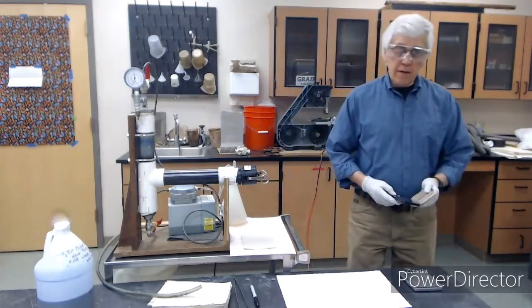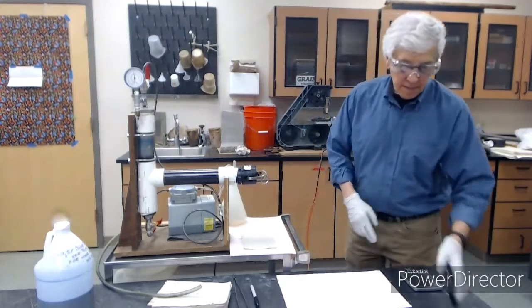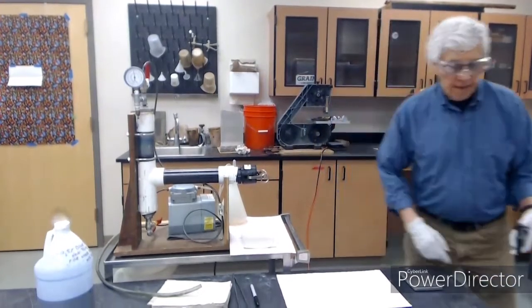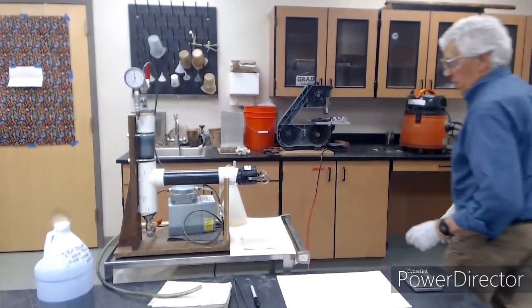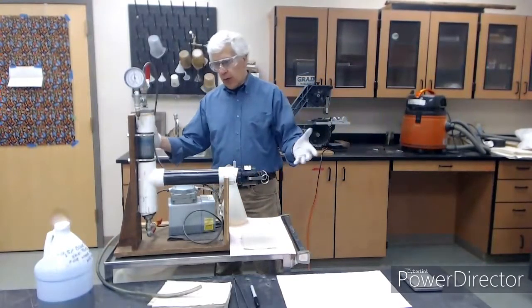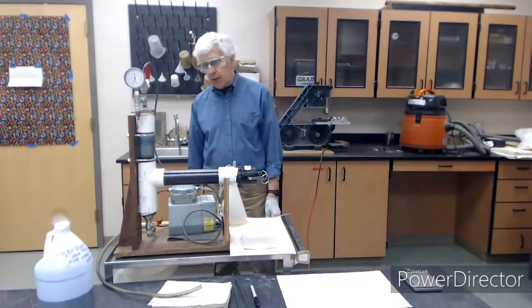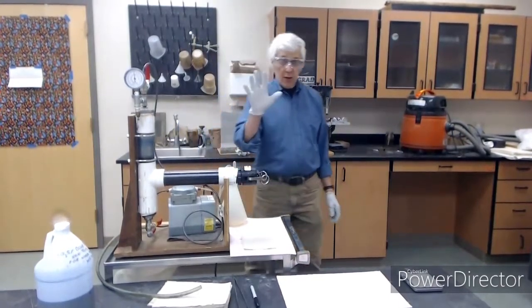And I forgot to start the timer again, so we're going to have approximately 5 minutes. So all we can do now is wait. So let's wait, and I will be back in approximately 5 minutes. Let's see how far down this is.